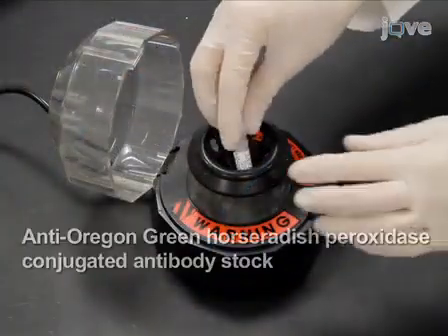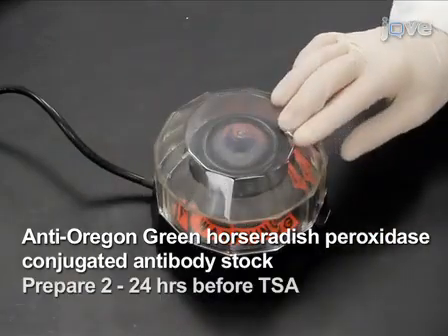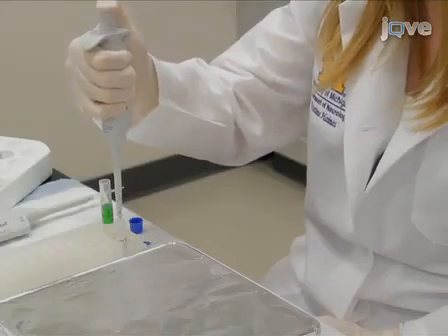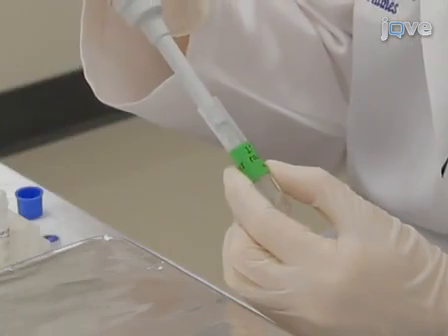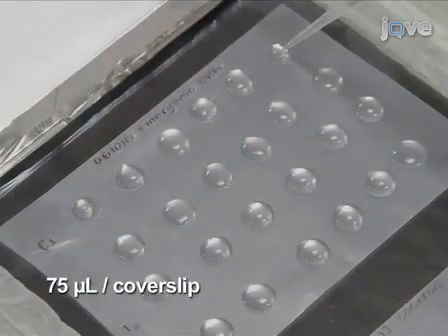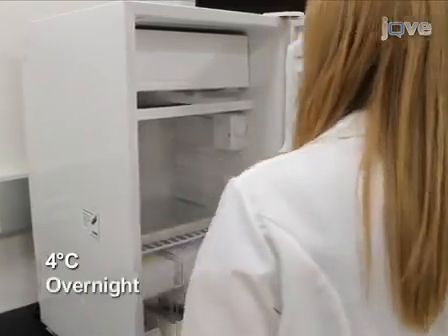Briefly spin the anti-Oregon green horseradish peroxidase conjugated antibody stock prepared 2 to 24 hours in advance of TSA. Dilute the primary antibody 1 to 300 in TSA blocking solution and invert or pipette to mix. Do not vortex. Add 75 microliters to each cover slip and incubate at 4 degrees Celsius overnight.